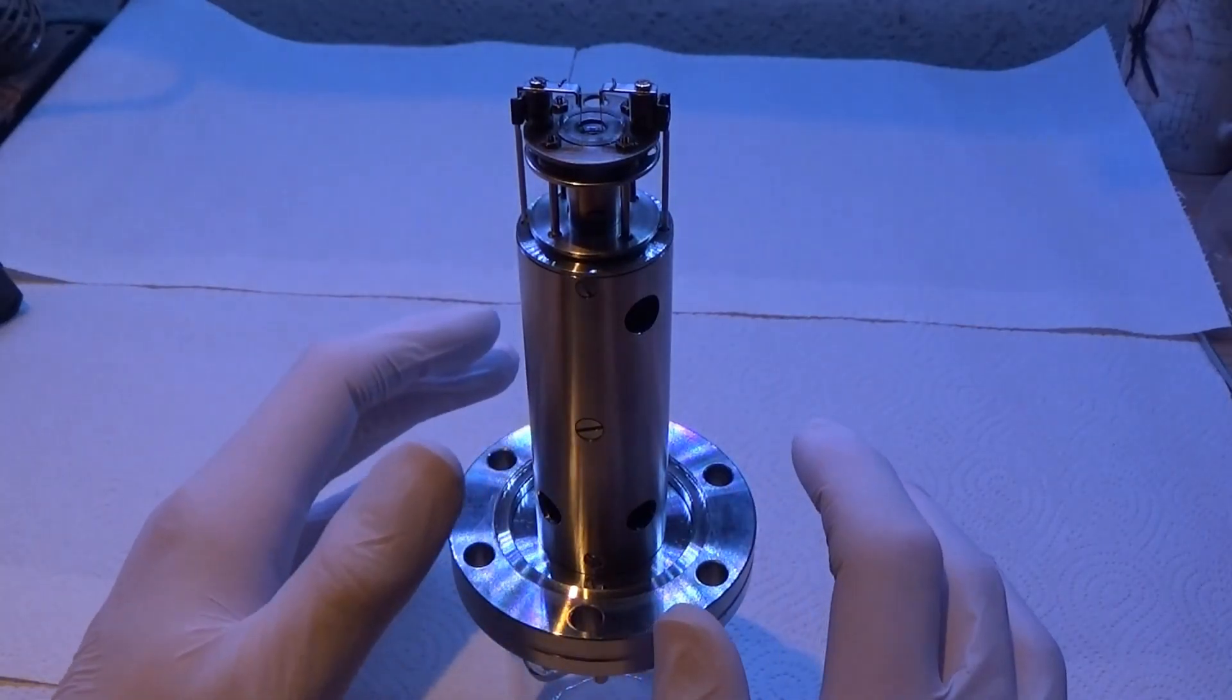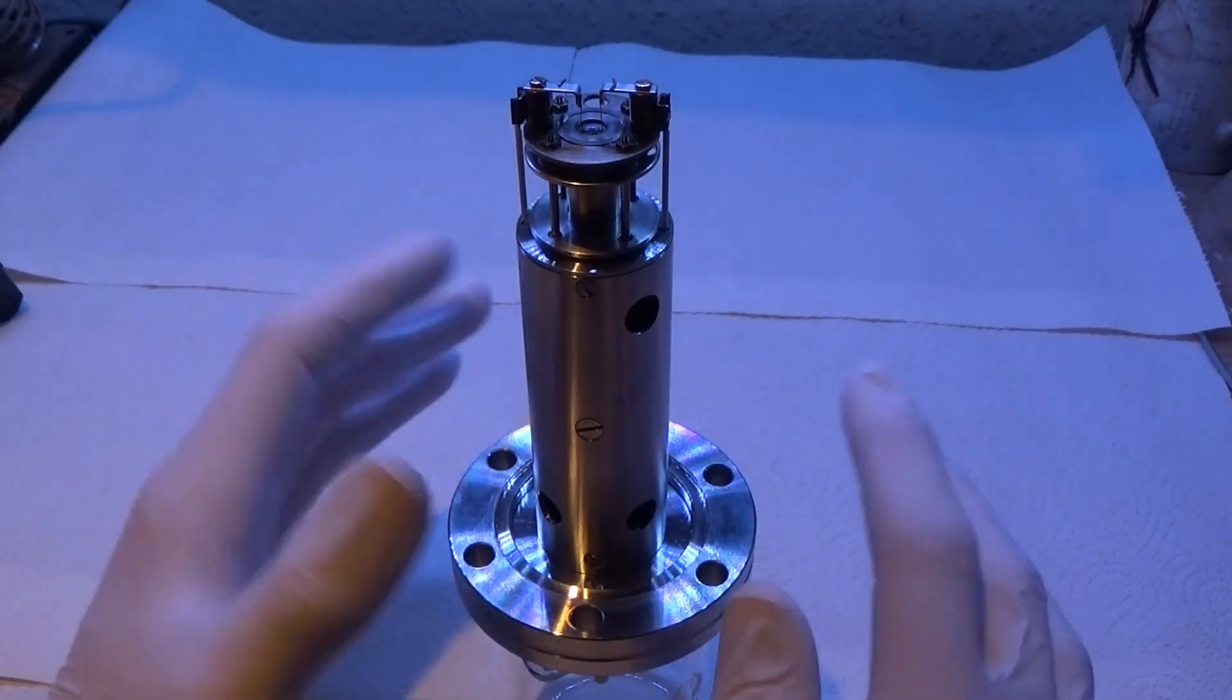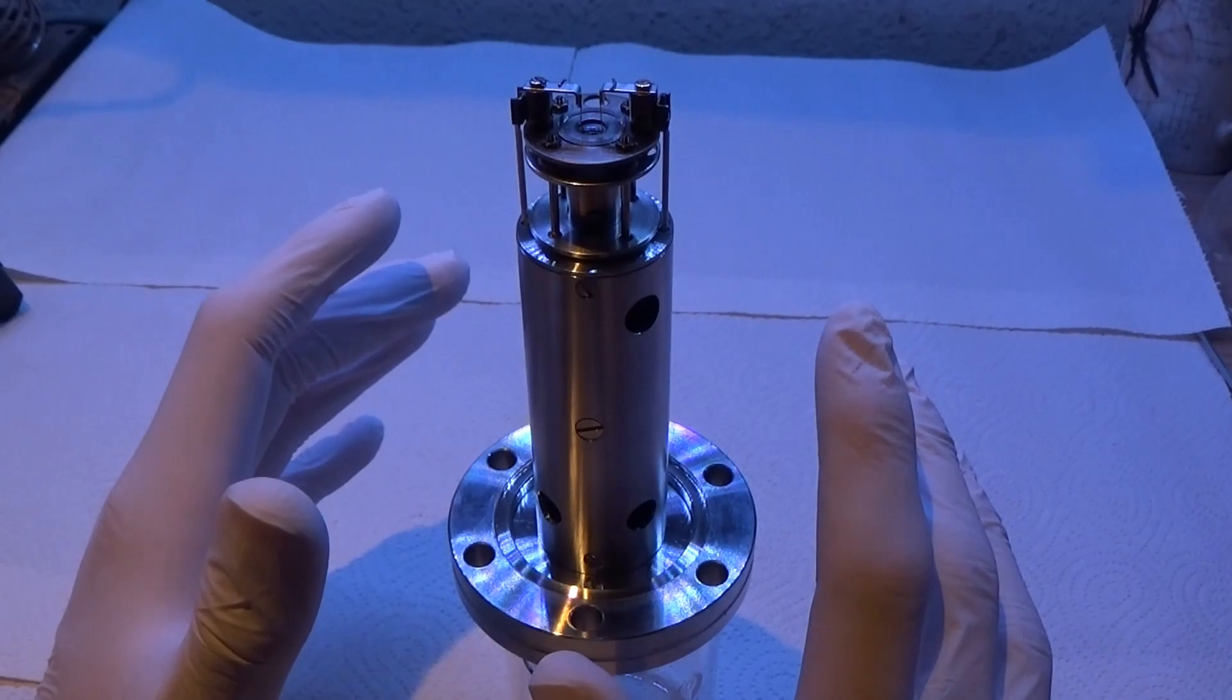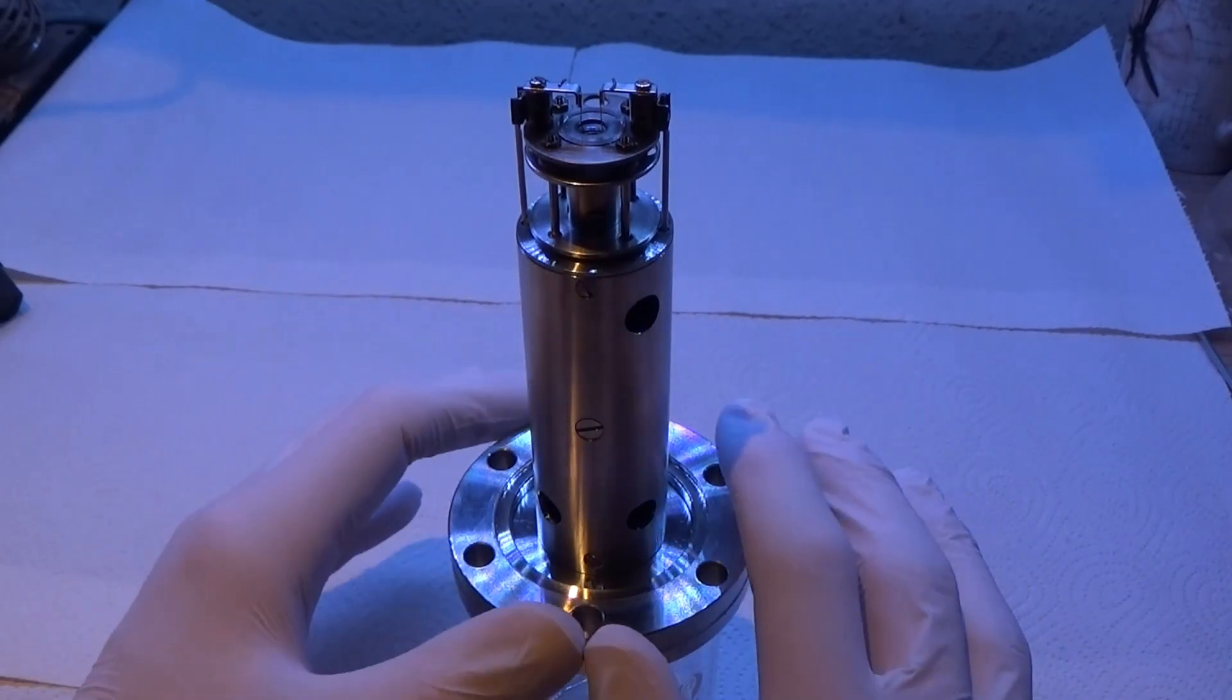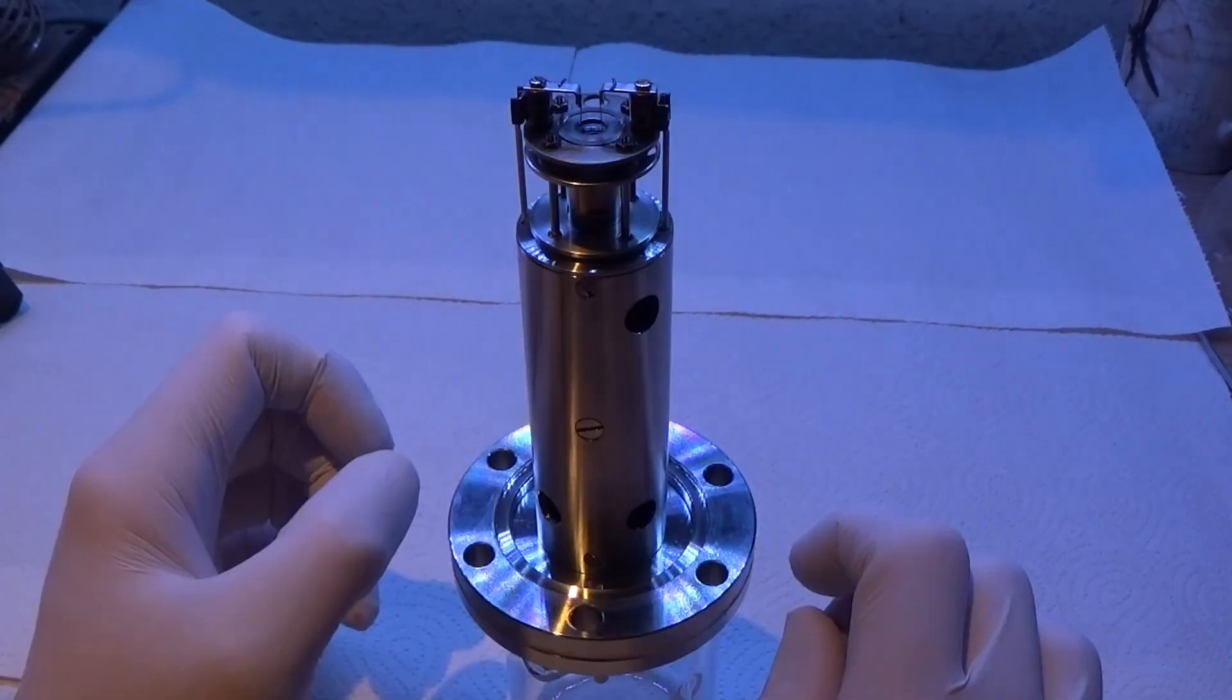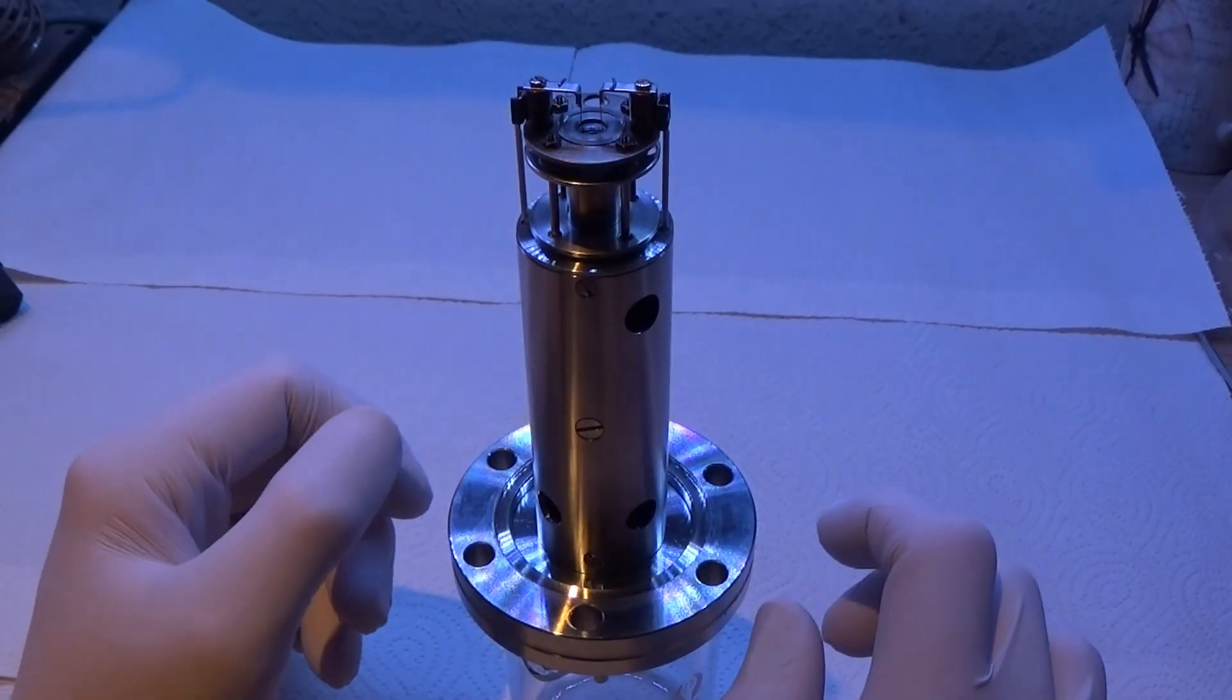I'm going to attempt to actually build the electronics for this and get it working, because I think it's a nice challenge. I had to take this apart when I got it because it was kind of rattly. It's intact, nothing is broken, but it's by far the simplest mass spectrometer I've ever seen. There's only something like five connections to the outside world, so it should be pretty easy to interface.